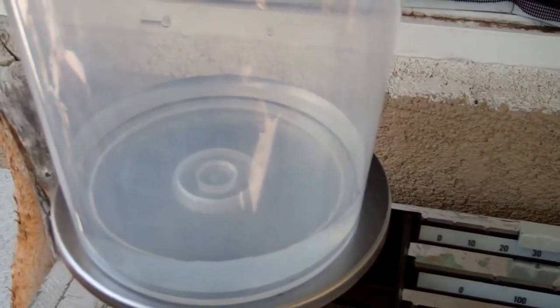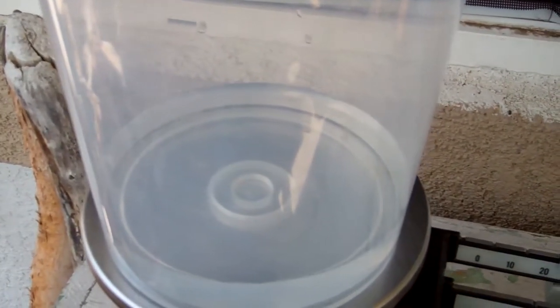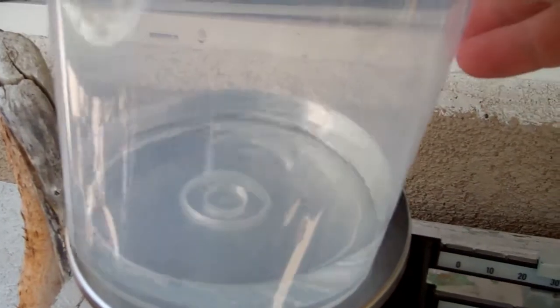Mass of the water plus this container. So if you are asked to get the mass of some water, don't forget your water's sitting in a container.